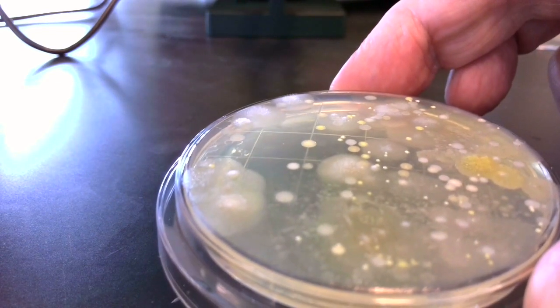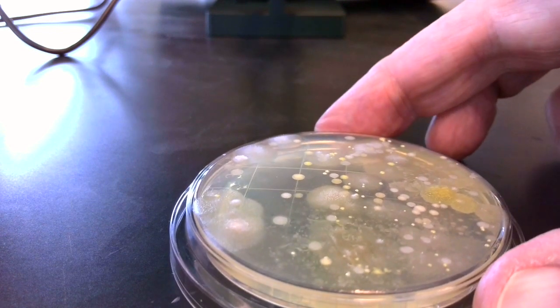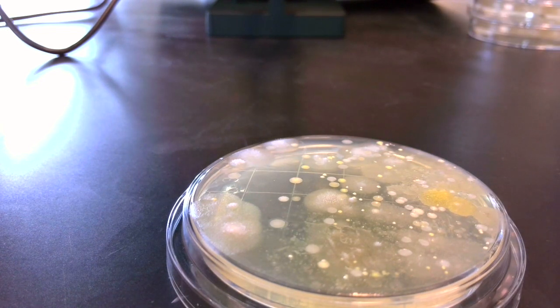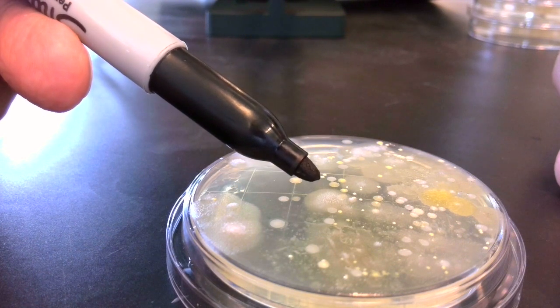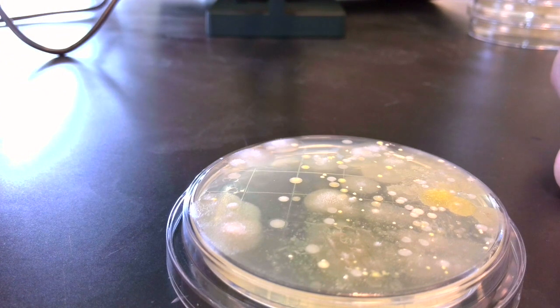And from what goes on at home, you probably already know that that could be mold, and indeed it is. And those little round balls are the spore packages, which in this case we would refer to as their morphology, because they're nice and round. If you looked under the microscope, we would call them sporangium. So on a plate we have colonies and we have mycelia growing both at the same time. And in the next step, I'm going to come back and show you what we would do to be able to separate them from one another.